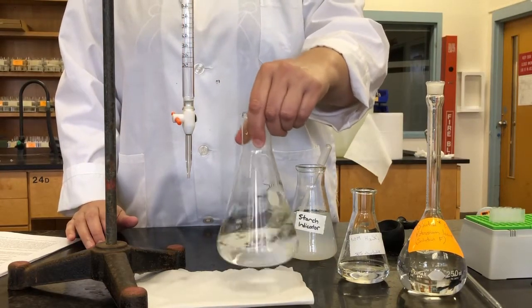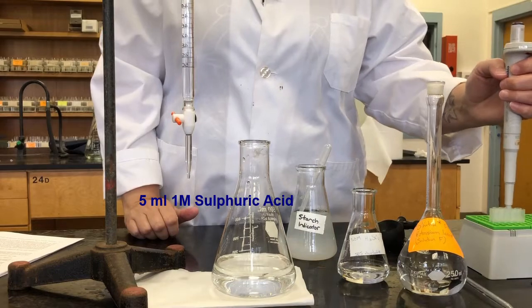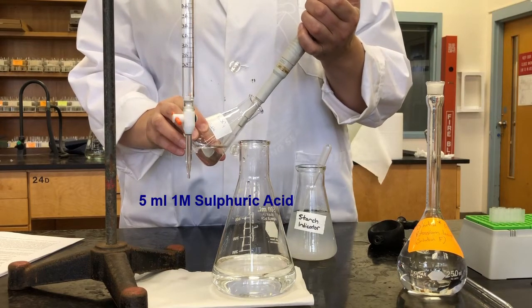Swirl to dissolve. Now we're going to add 5 milliliters of sulfuric acid. So we're going to use an Eppendorf for that. 5 mils.